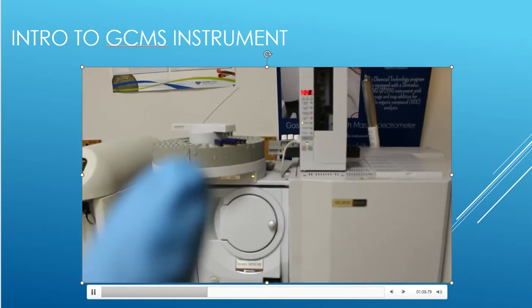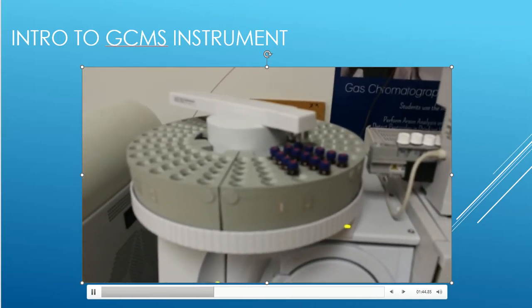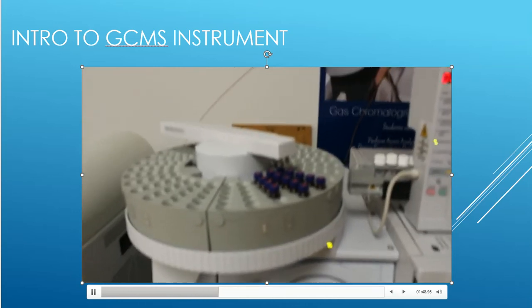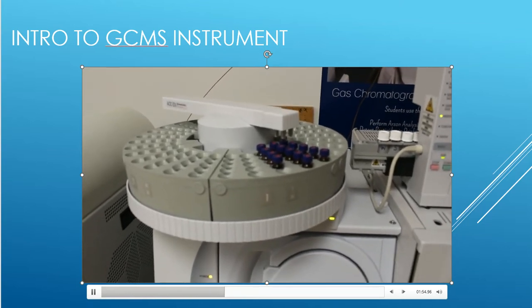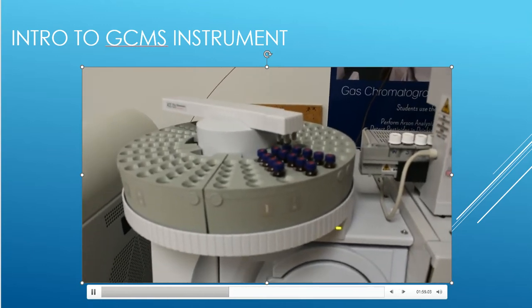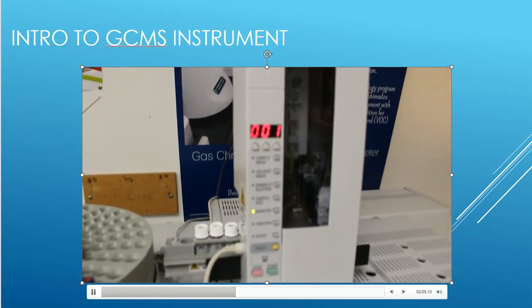What you see up here on the top is a carousel. This carousel is made to hold a number of different samples at one time, so that we can just load all of these up and set it and forget it. This carousel will hold over 100 samples for us, and we can just line them up and tell the software to inject them one by one. It will inject them, and that injection is taking place over here.